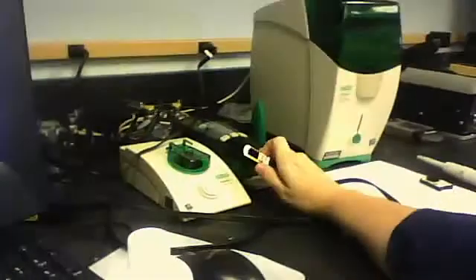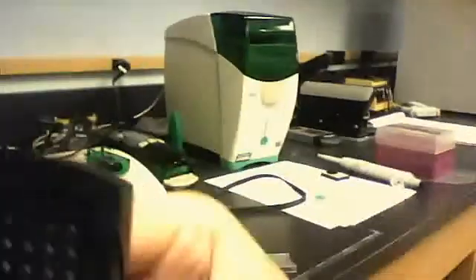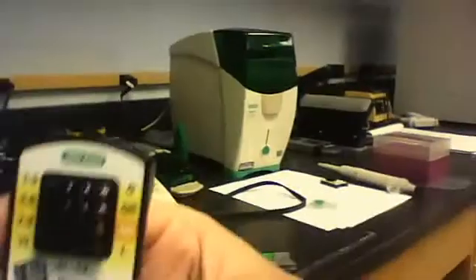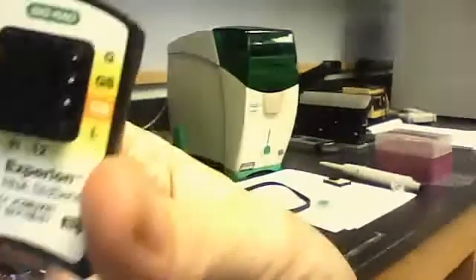Once the machine is done priming, you want to take a look at the chip. Take a look at that. The back of the chip did have some little lines on it before you actually primed it. After you prime it, you won't see any lines. You shouldn't see any lines because if you do, you need to throw that chip away and prime another chip. And also if you see air bubbles, that could cause an issue. You want to throw it away and try to prime another chip.